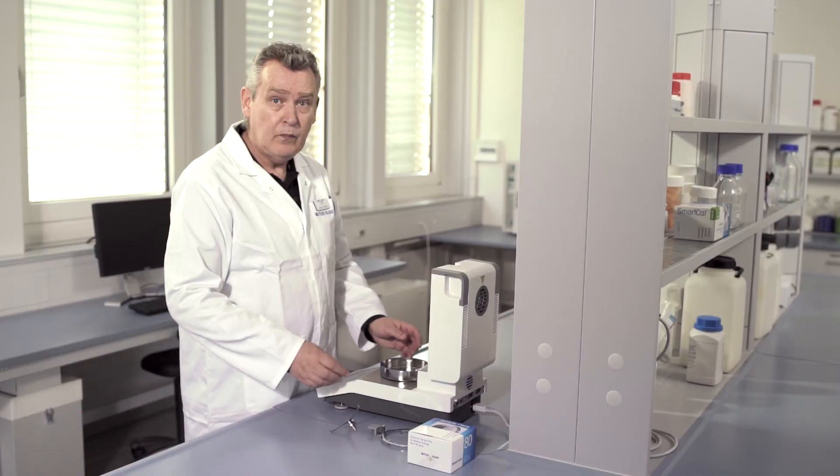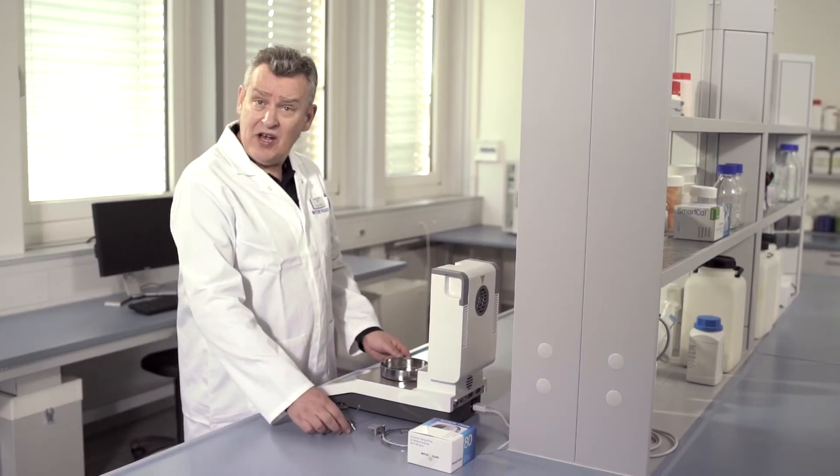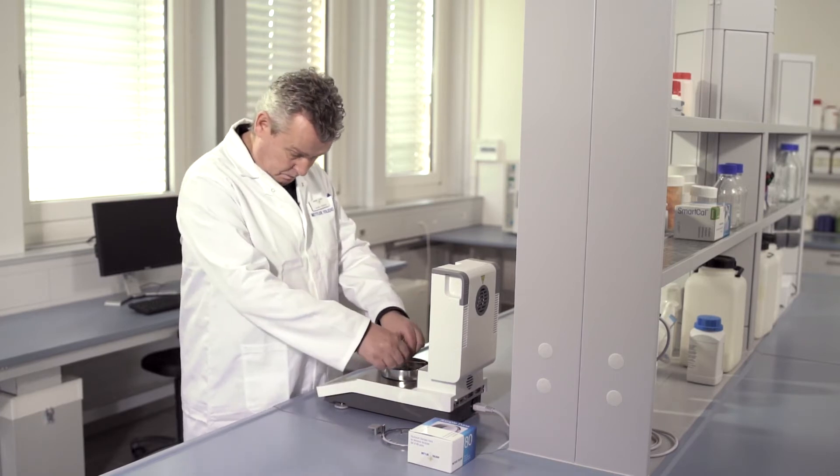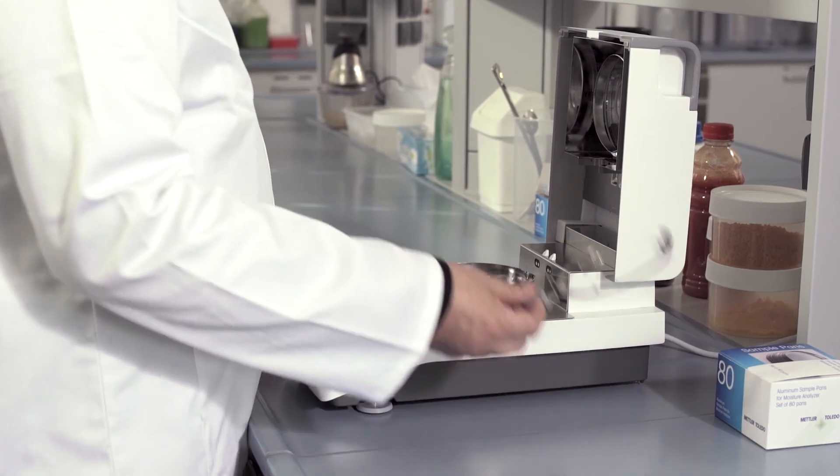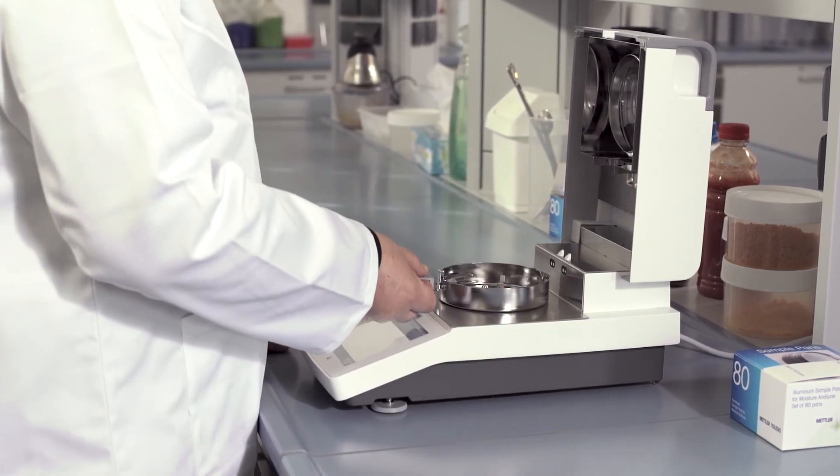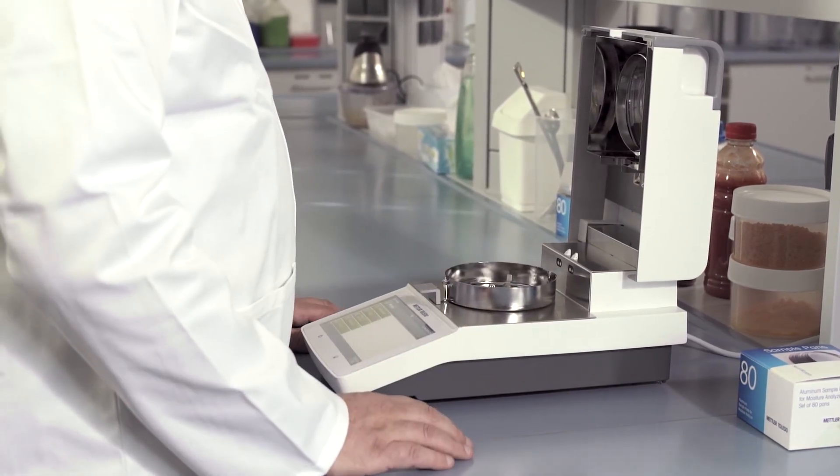Then add the sample pan holder, add the sample pan handler and then close the lid.